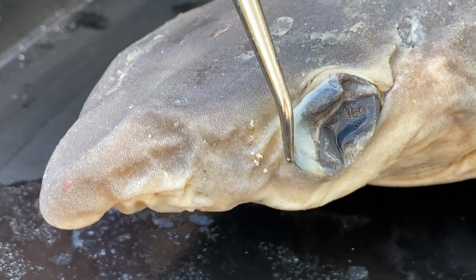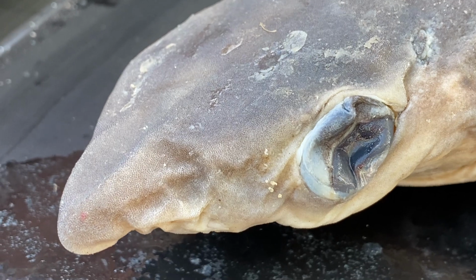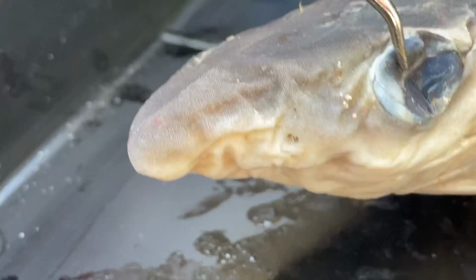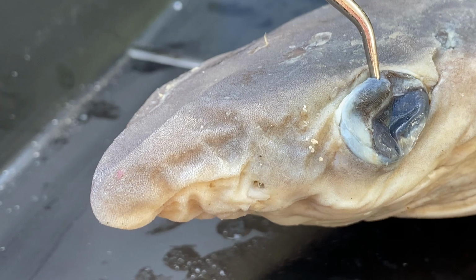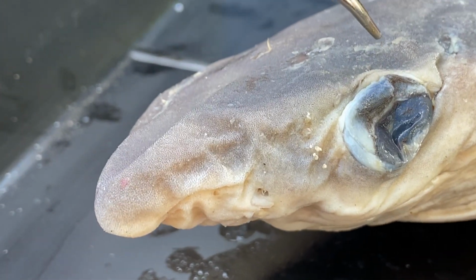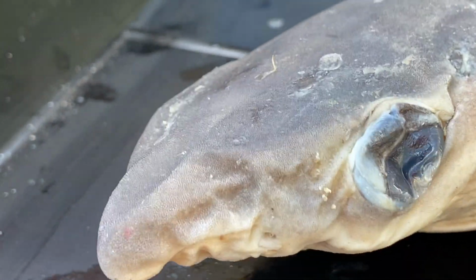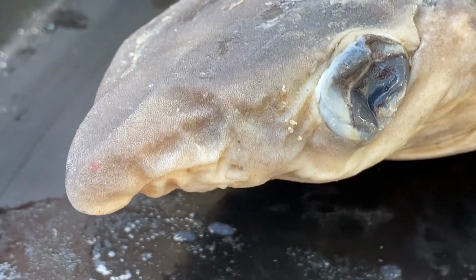On the other side, this side of the eyelid, see where it's a little bit whiter? It's more of like a thicker eye layer, if you will, and then it will roll right back after it bites its prey. They do have a lens inside just like we do, so if we remove the eye, you would feel a hard ball marble-like structure just like you did on the squid, just like we have in human eyes and cow eyes and all sorts of stuff. So their eyes are very good at seeing, but it is not one of their best senses. They don't see nearly as well as they smell or use their other senses.